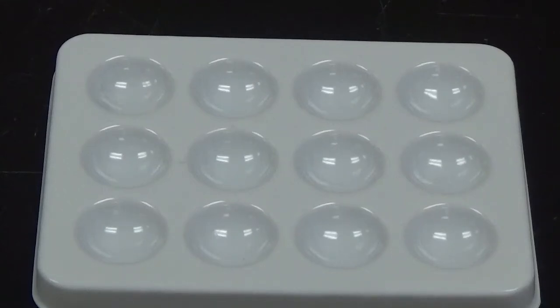Now, please be aware when you form your paper in this way that you're going to have doubles of all of the mixtures. So you'll only wind up doing about half of the table. So if you draw a diagonal line through all the boxes where the substance is mixed with itself, you will then only have to fill out either the boxes on the top of that line or underneath that line for all of the reactions.